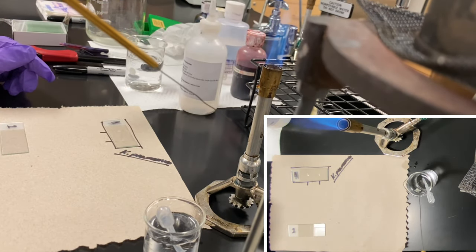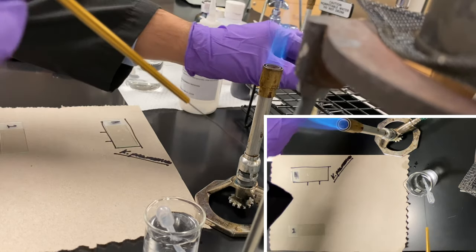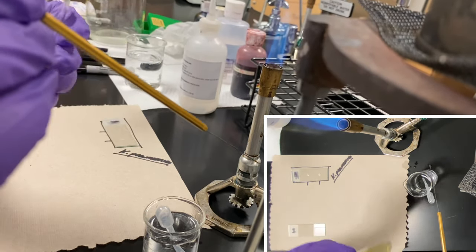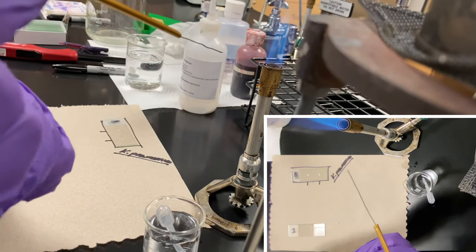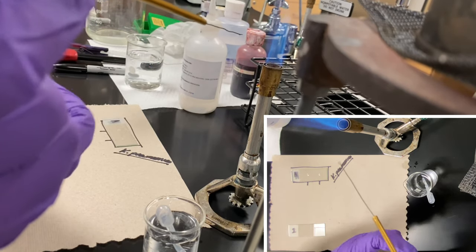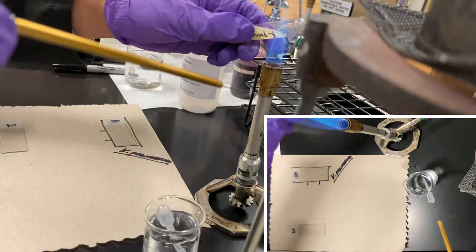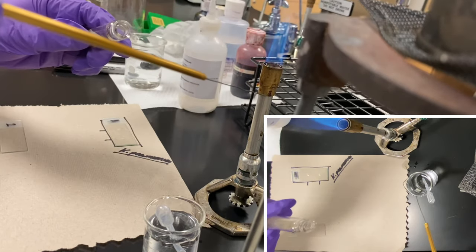I'm flaming away from this so I'm going to make sure I don't contaminate it. Then I actually take my organism. Pinky technique. Pass it twice. Make sure that this is sterile.